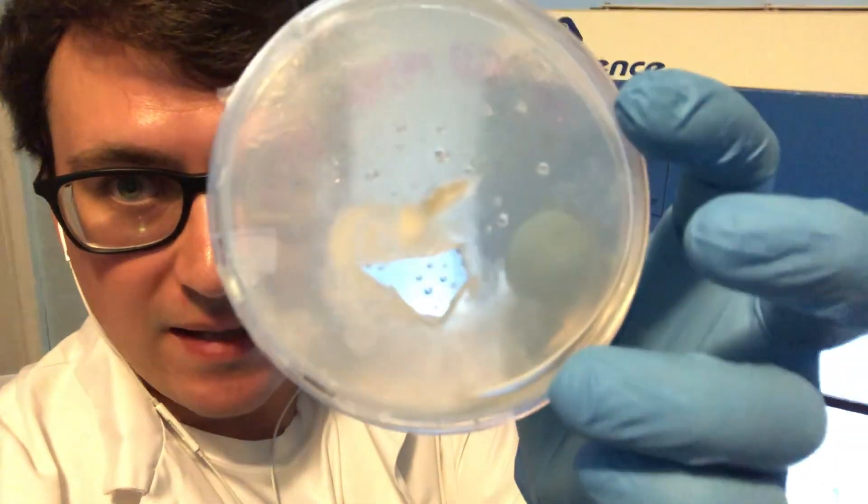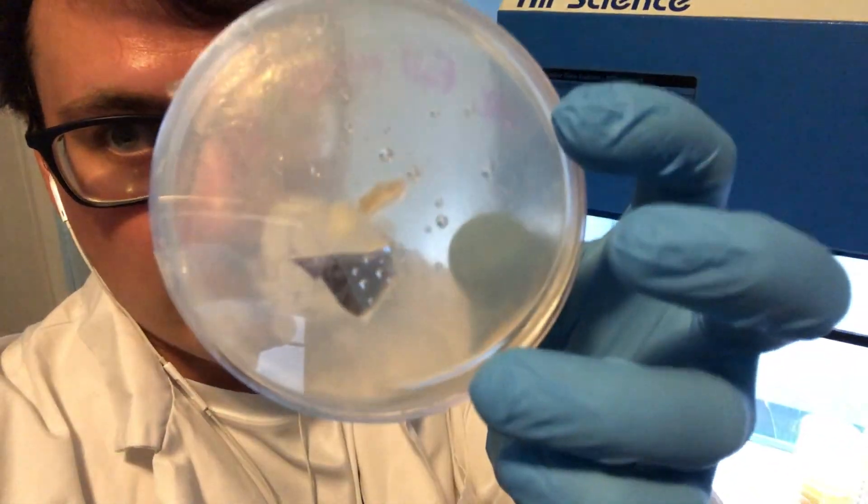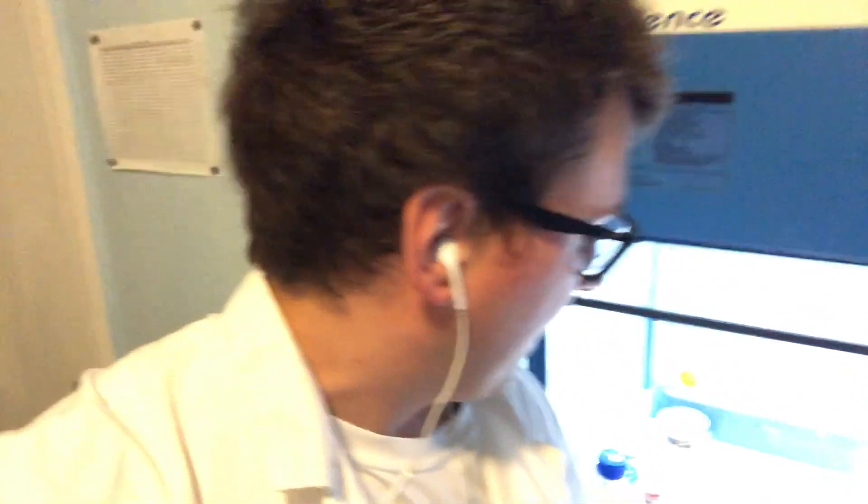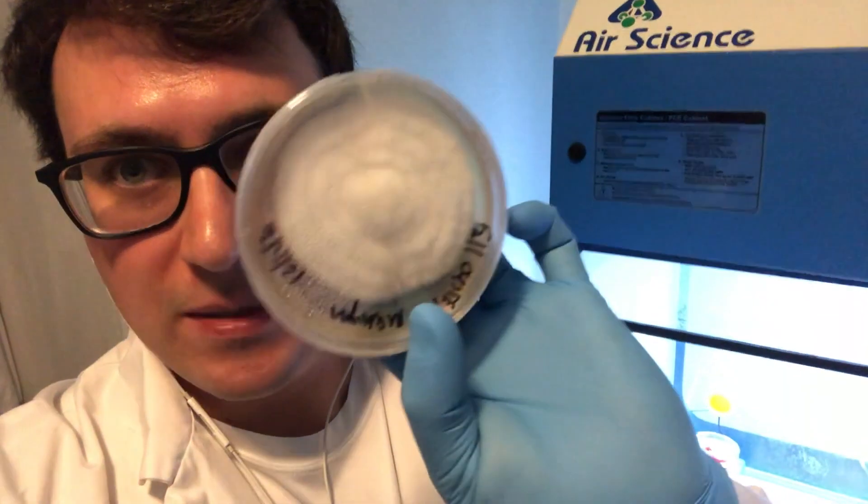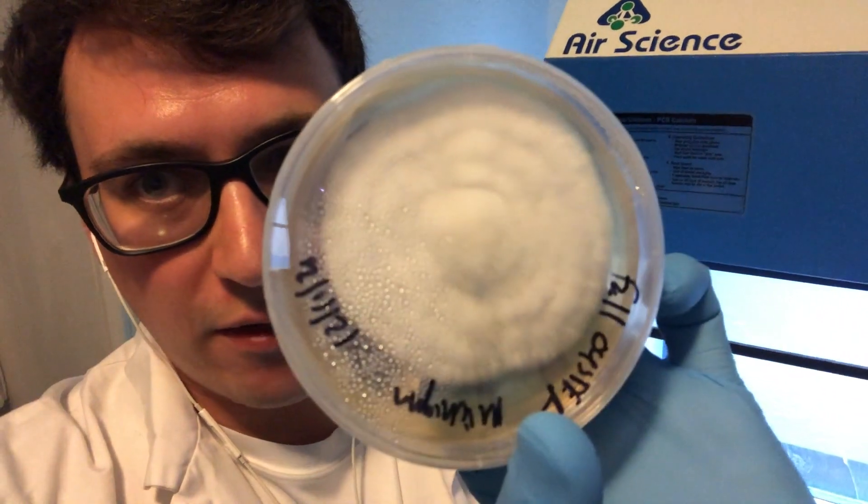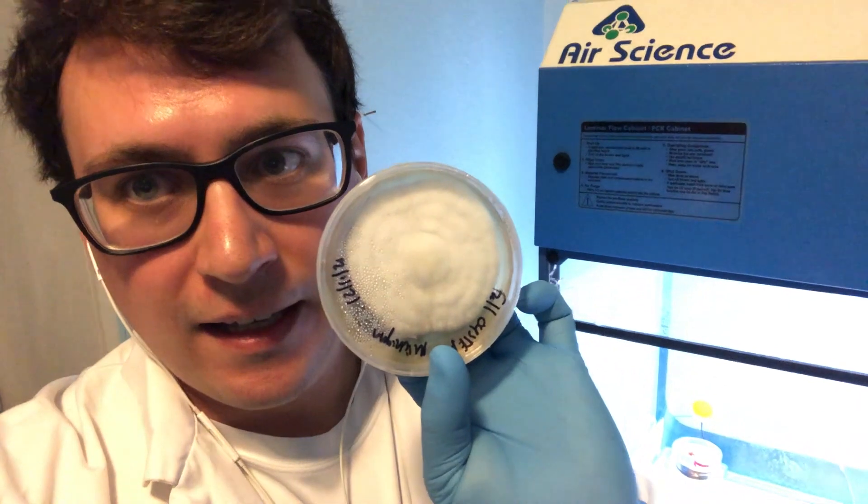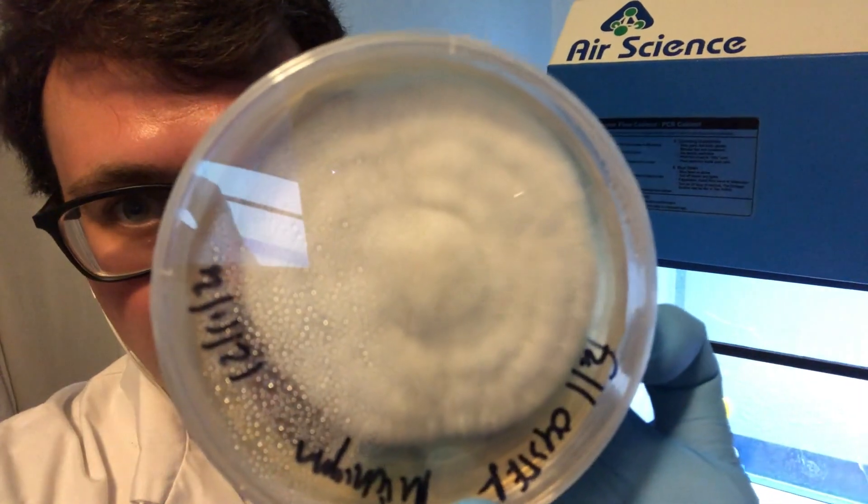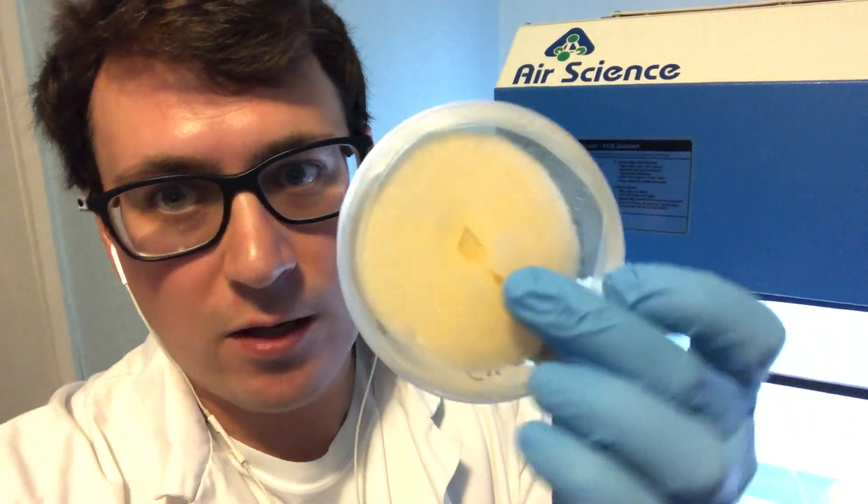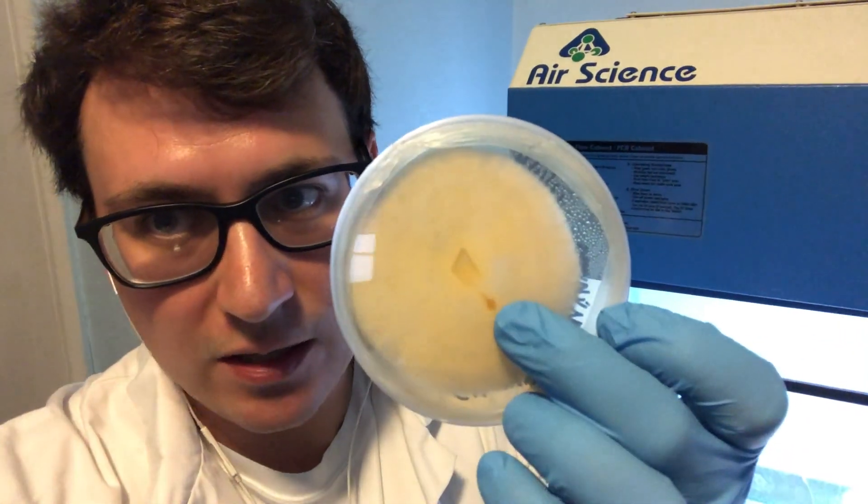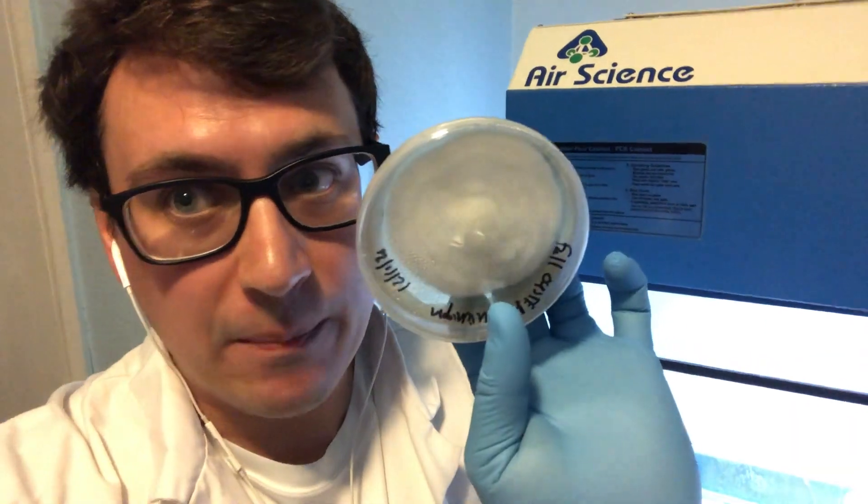So this is the updated culture after about 13 days on the plate and it is looking very healthy. Shout out to Blake from Michigan. I'm gonna fruit these out. You can see it looks like there's a little yeast right there.